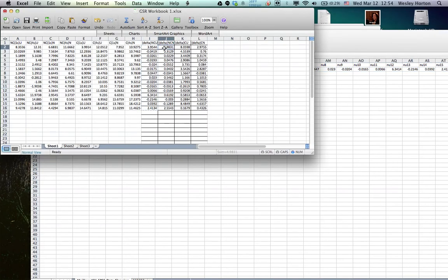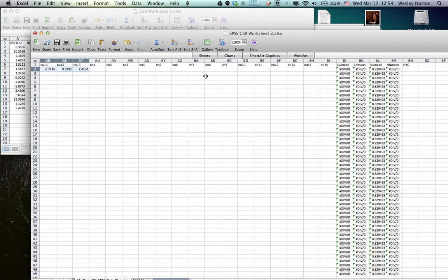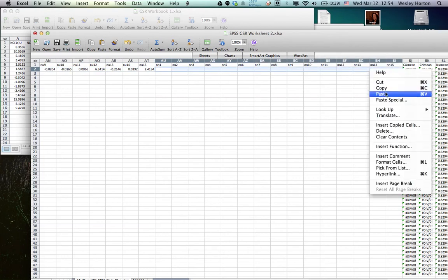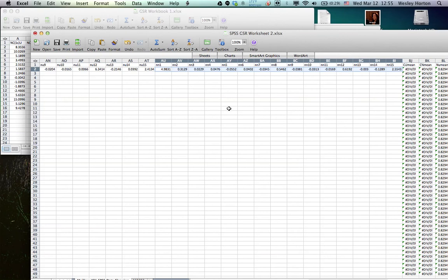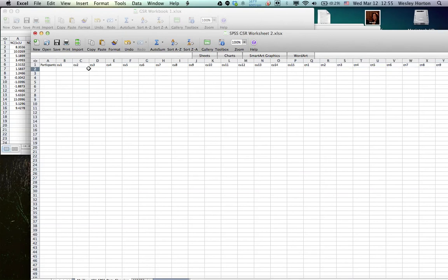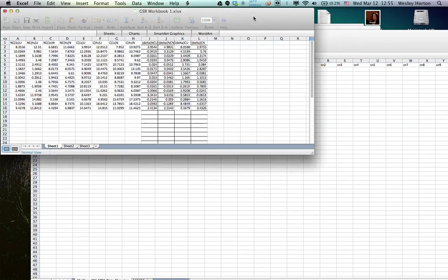All right. And now I want non-SIBS neutral. Do the same thing with that. Non-SIBS neutral. So it's going to be NN. Here we go. NN. Paste special. Transpose values. Okay. And then we'll go back and grab SIBS unpleasant. Paste that in. And then finally our SIBS neutral.